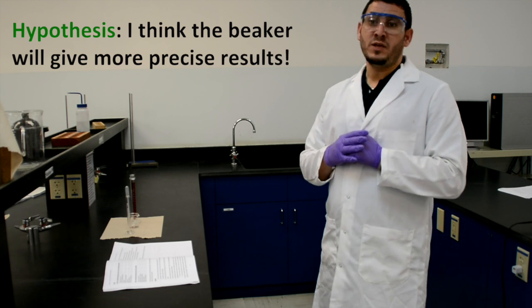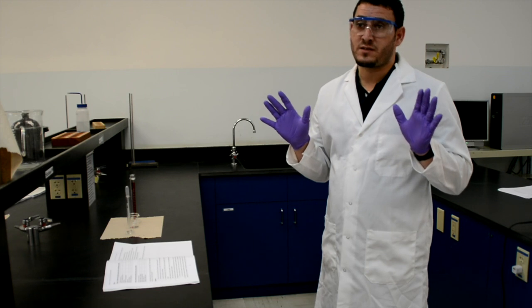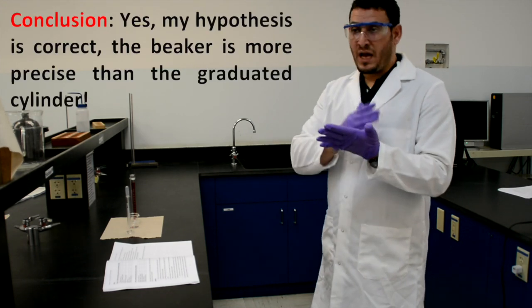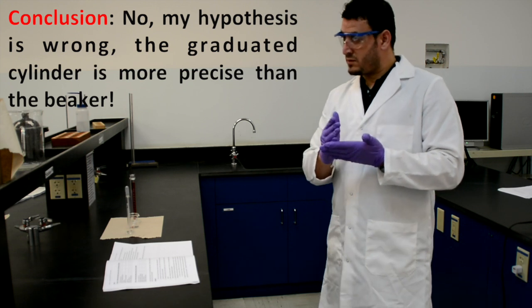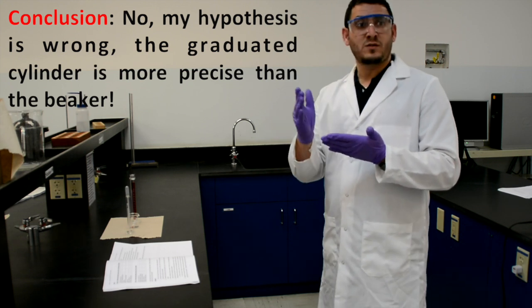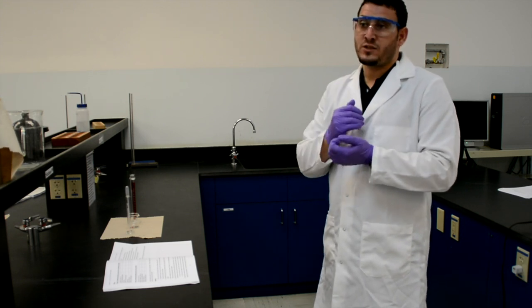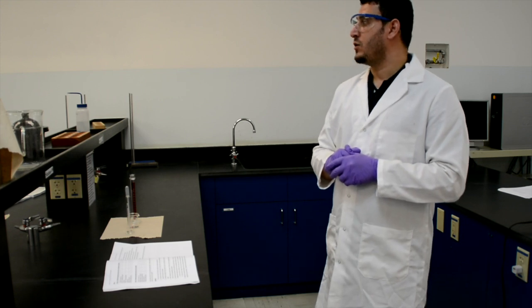As a hypothesis for your experiment, you could say: 'I think the beaker will be more precise than the graduated cylinder.' In your conclusion, you say whether your hypothesis was correct or not. For example, you might conclude the graduated cylinder is more precise than the beaker. It's not required that you guess the correct hypothesis — the hypothesis is just your prediction before the experiment.